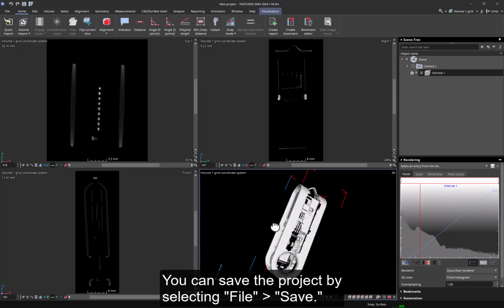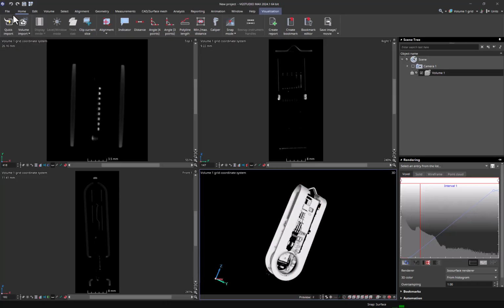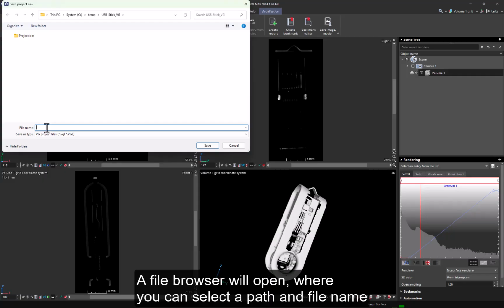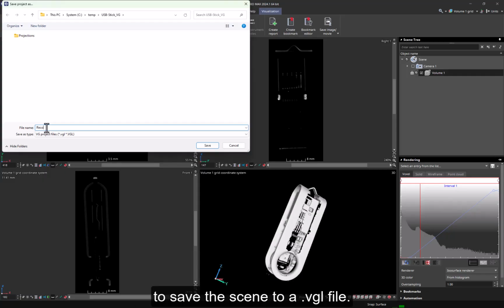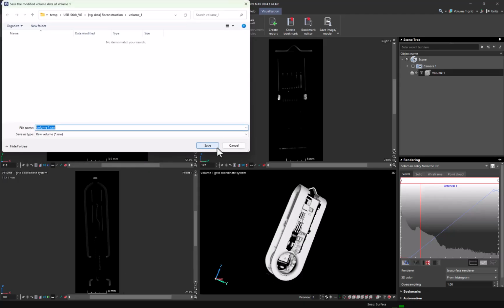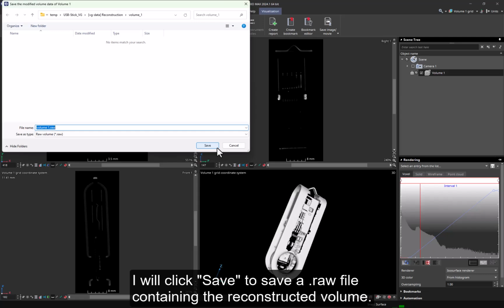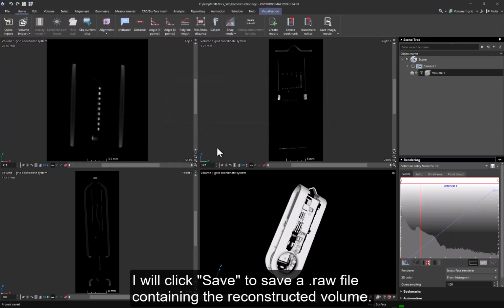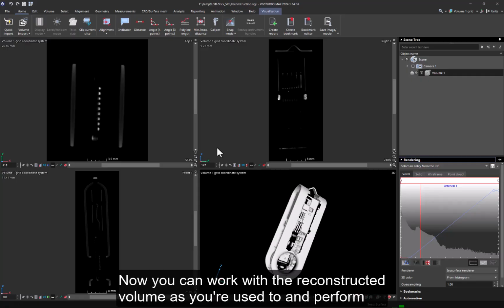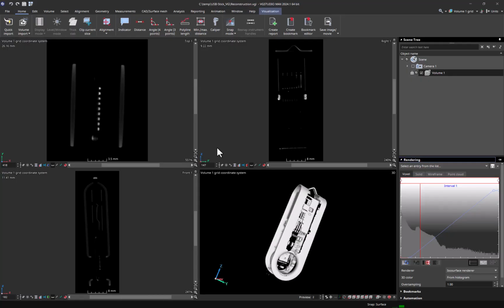You can save the project by selecting File Save. A file browser will open, where you can select a path and file name to save the scene to a VGL file. After that, you will be asked if you want to save the modified volume data. I will click Save to save a raw file containing the reconstructed volume. And that's it. Now you can work with the reconstructed volume as you're used to and perform analysis or measurement tasks.